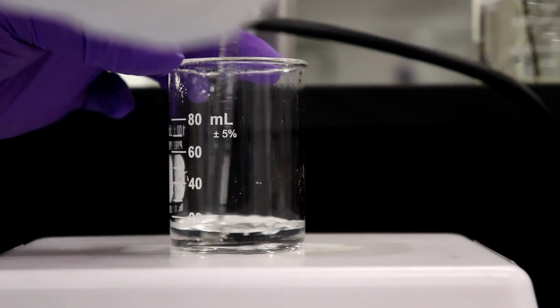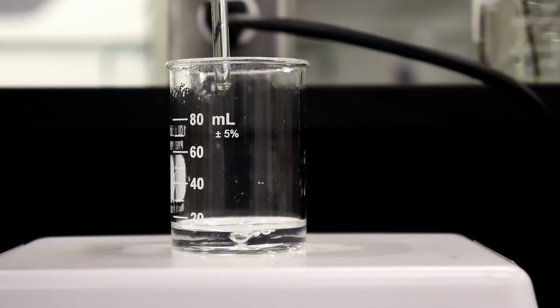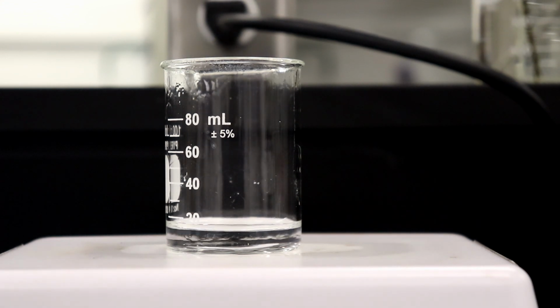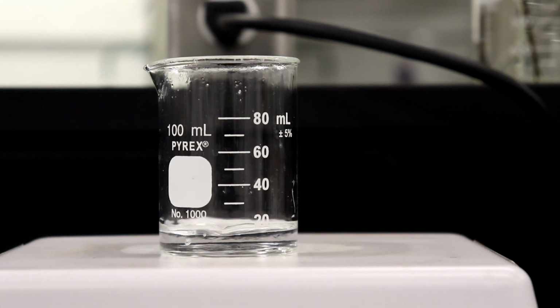And as we can see now, our beaker is actually clean. Because as it boils, it condenses on the side right here, and the water falls back down and actually pulls everything down to the bottom. So that's looking quite great and awesome.